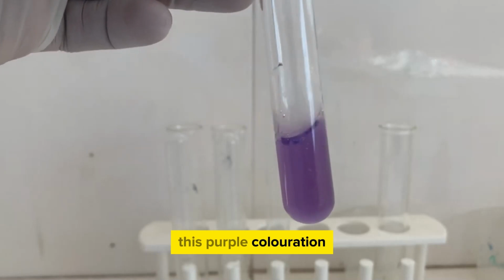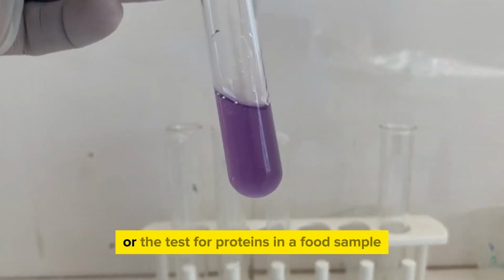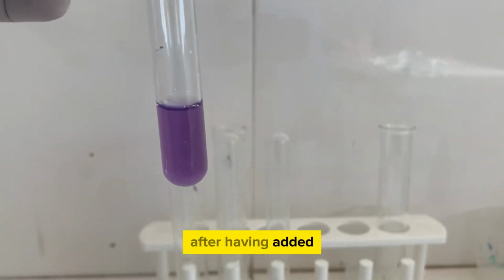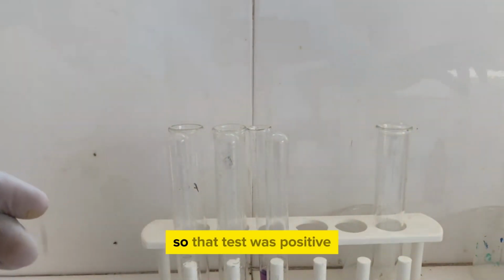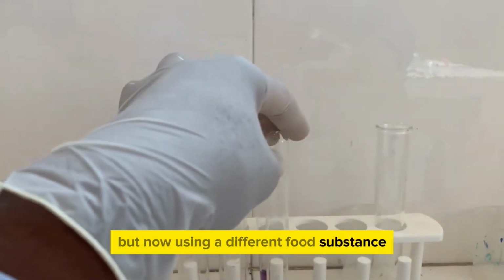This purple coloration is a positive test for the biuret test, or the test for proteins in a food sample, after having added sodium hydroxide and a few drops of copper sulfate. So that test was positive. I'm going to repeat this test now, but now using a different food substance.